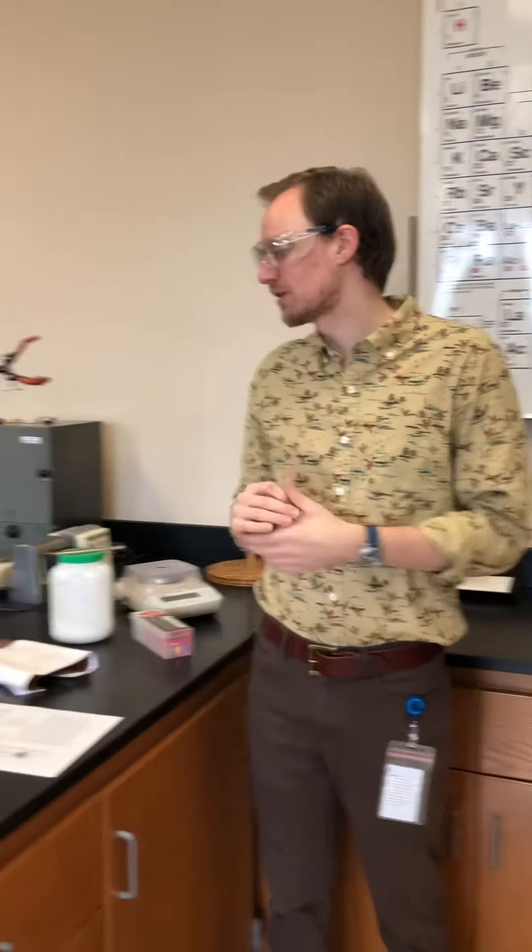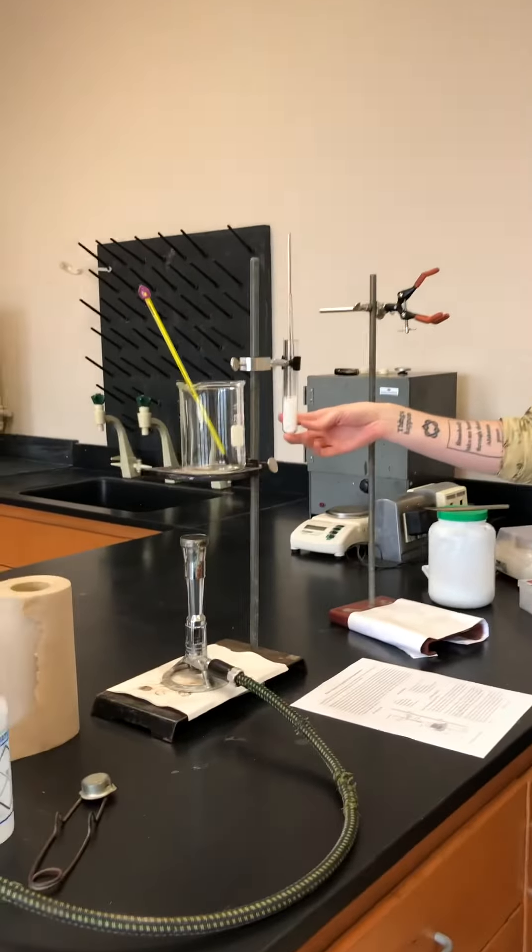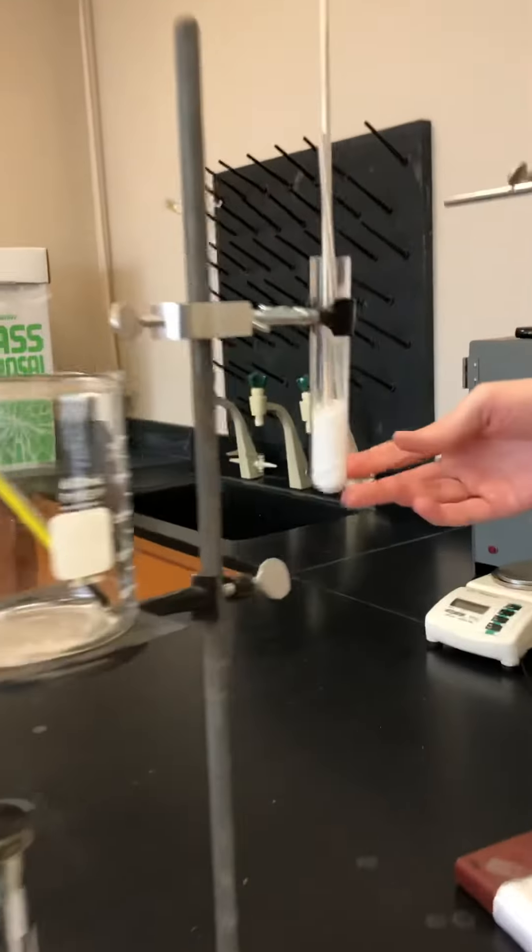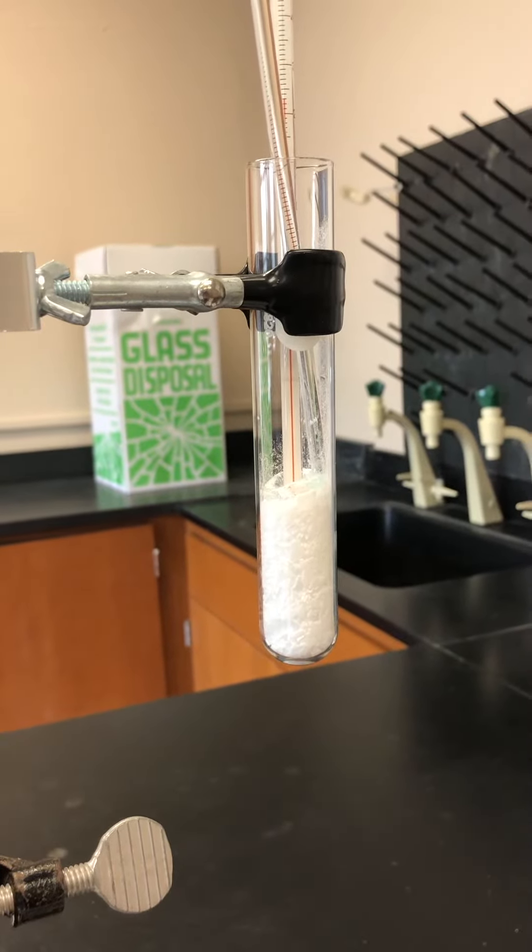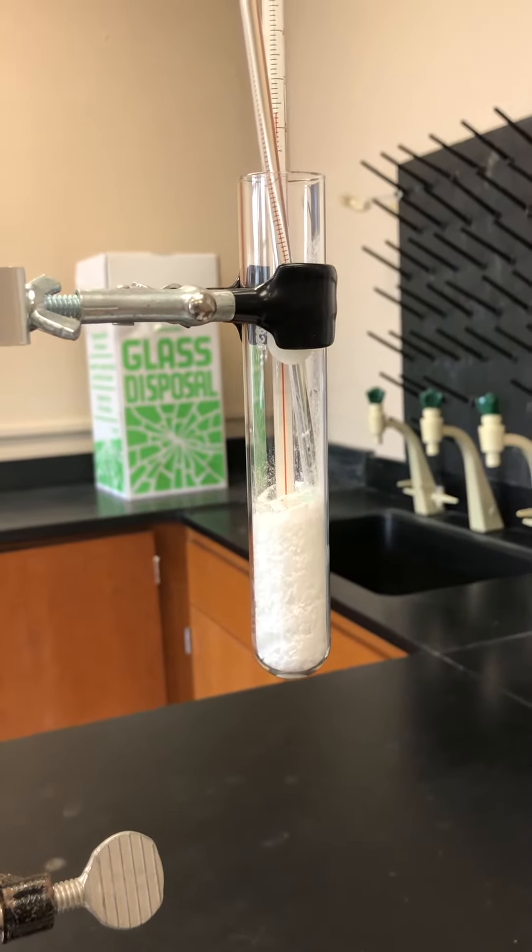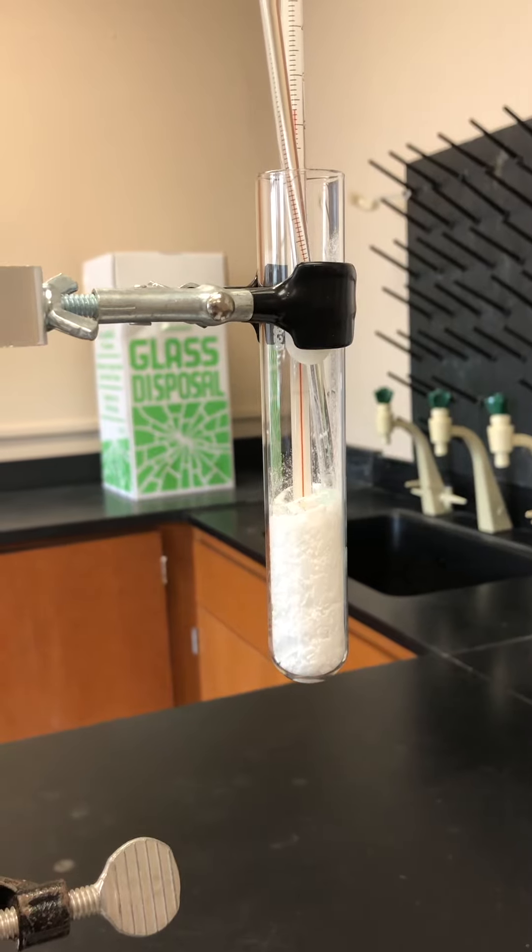So in this lab we're going to determine the freezing point of stearic acid, which is a solid at room temperature, but its freezing point is somewhere between room temperature and the boiling point of water, which is 100 degrees Celsius.